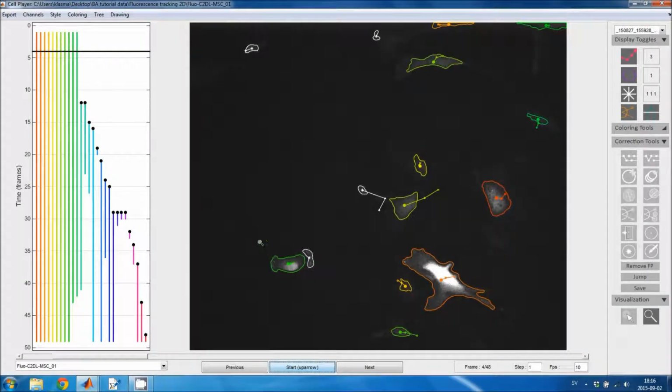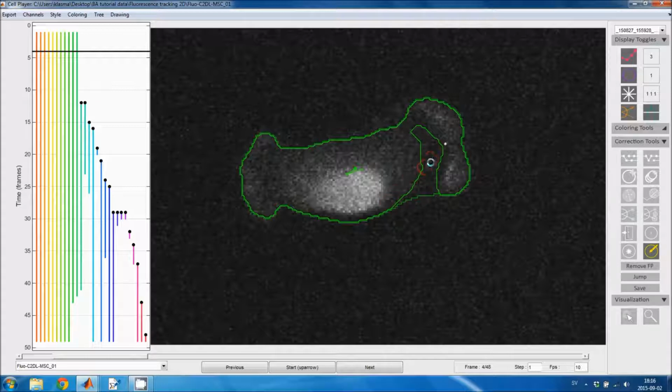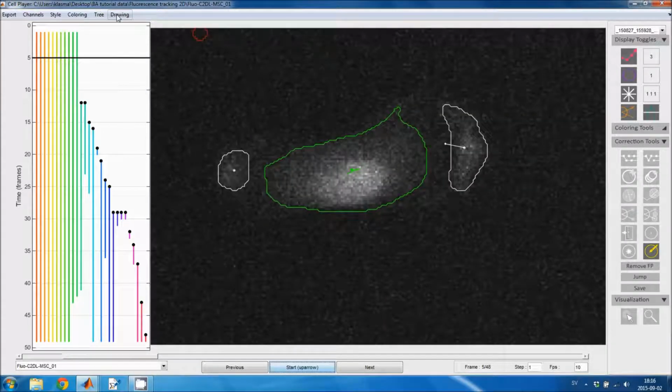You can also join false positive regions with tracks in them using the segmentation editing tool. So if I include or draw on both these regions, then the false positive region is incorporated into this cell region. And holes are filled in by default. So this hole disappeared. But you can choose in these menus to allow holes, and in that case the hole will not be filled in. You get a hole in the final region.